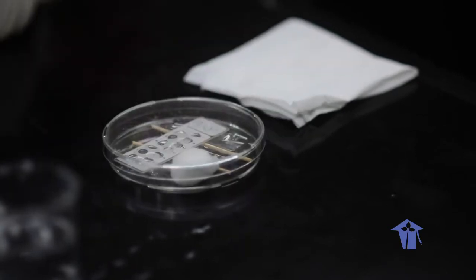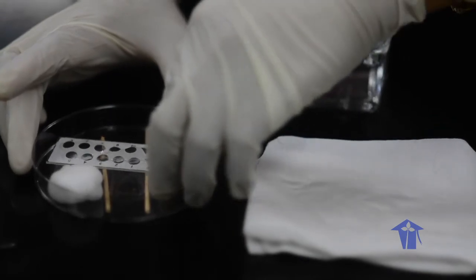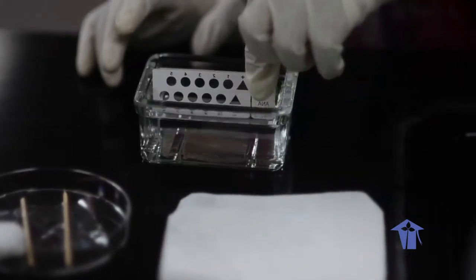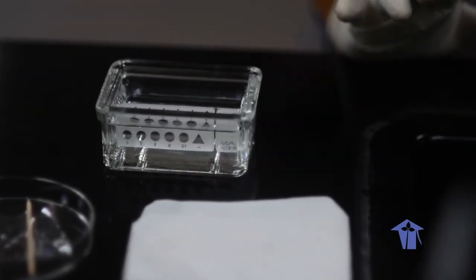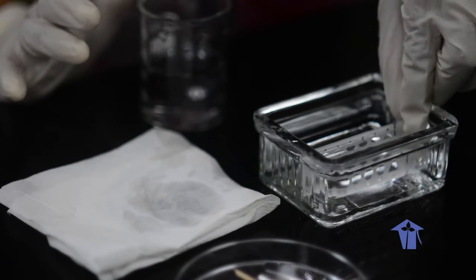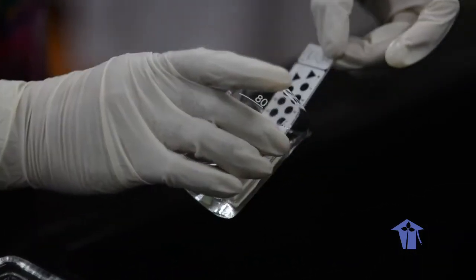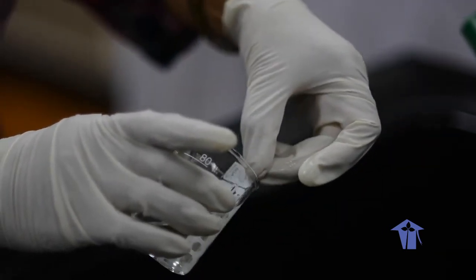30 minutes. 30 minutes is up with the FITC. Going to put it back in the PBS for 10 minutes. Agitate on entry, in the middle and at the end. Once the 10 minutes is up, we're going to place it in the distilled water. Make sure you cover the entire surface to remove the excess PBS.